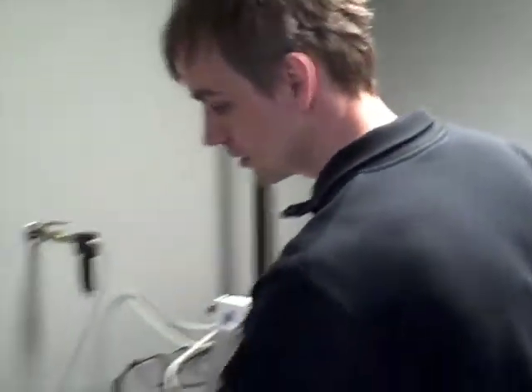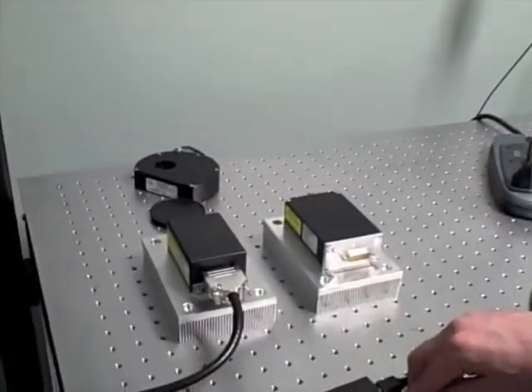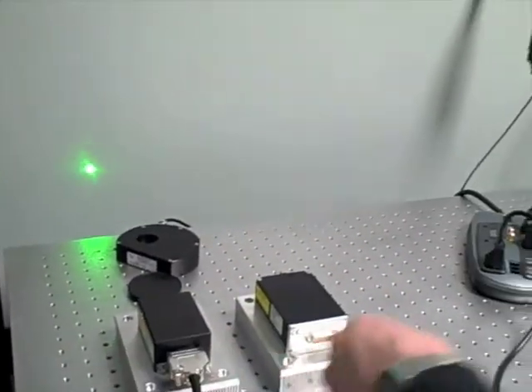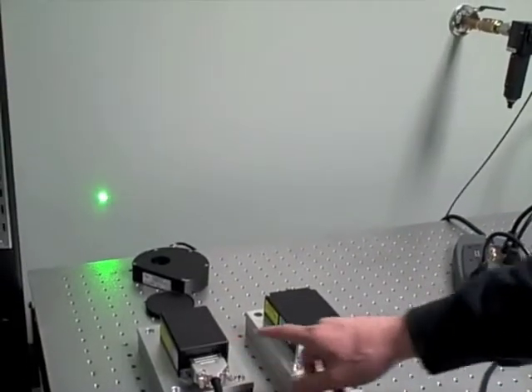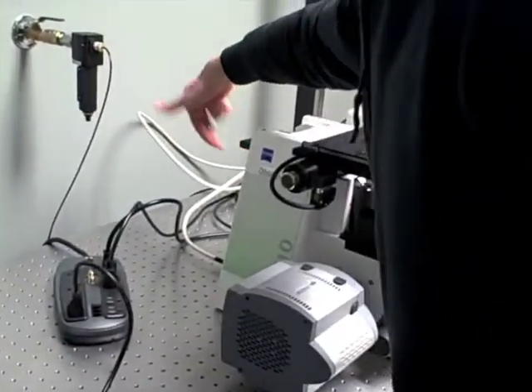These are my lasers. They're small diode-pumped solid-state lasers. They're very small now, practically a laser pointer. This one is green, it's 561 nanometers. This one is blue at 491. They will eventually be coupled into fiber optic cables, and then the fiber optic cables will launch the lasers into the back of the microscope.